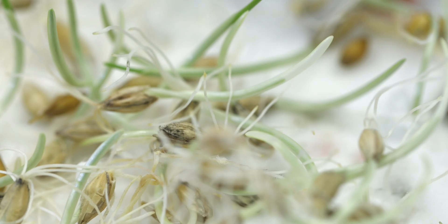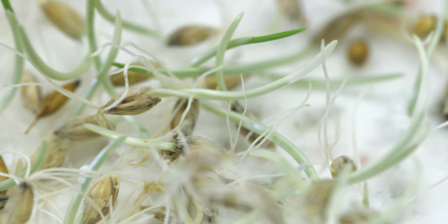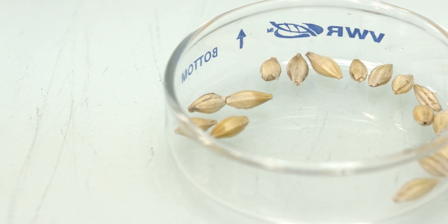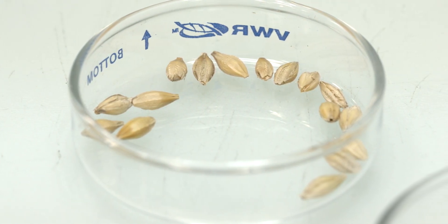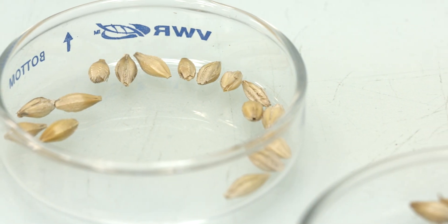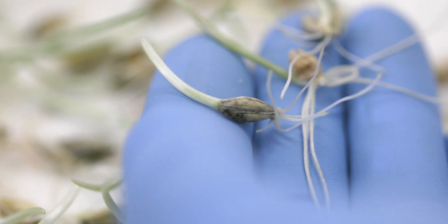For example, in this case, we can determine that the growing season for this crop, especially leading up to harvest, was poor. We have seedlings that are in various stages of growth — we call this uneven germination — with seedlings that are normal and healthy but are growing at different rates.